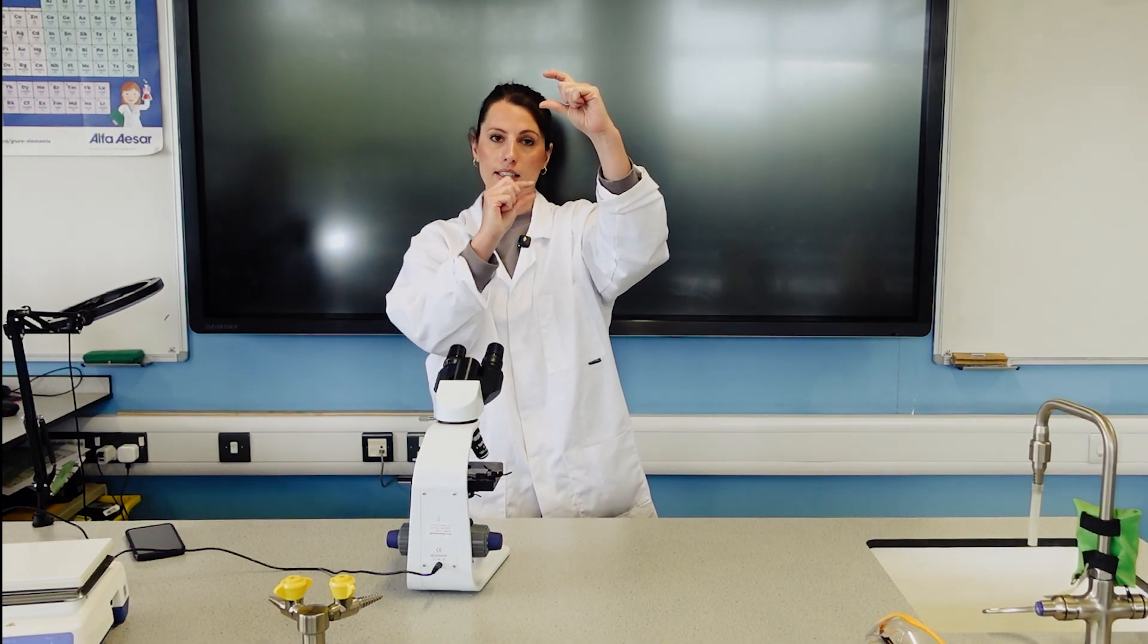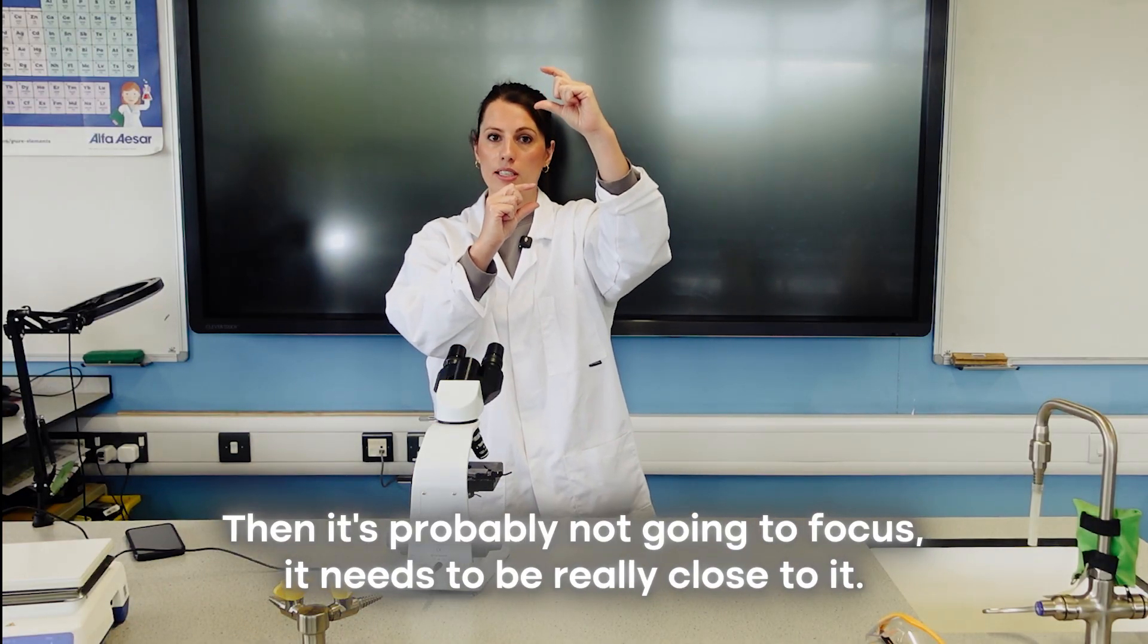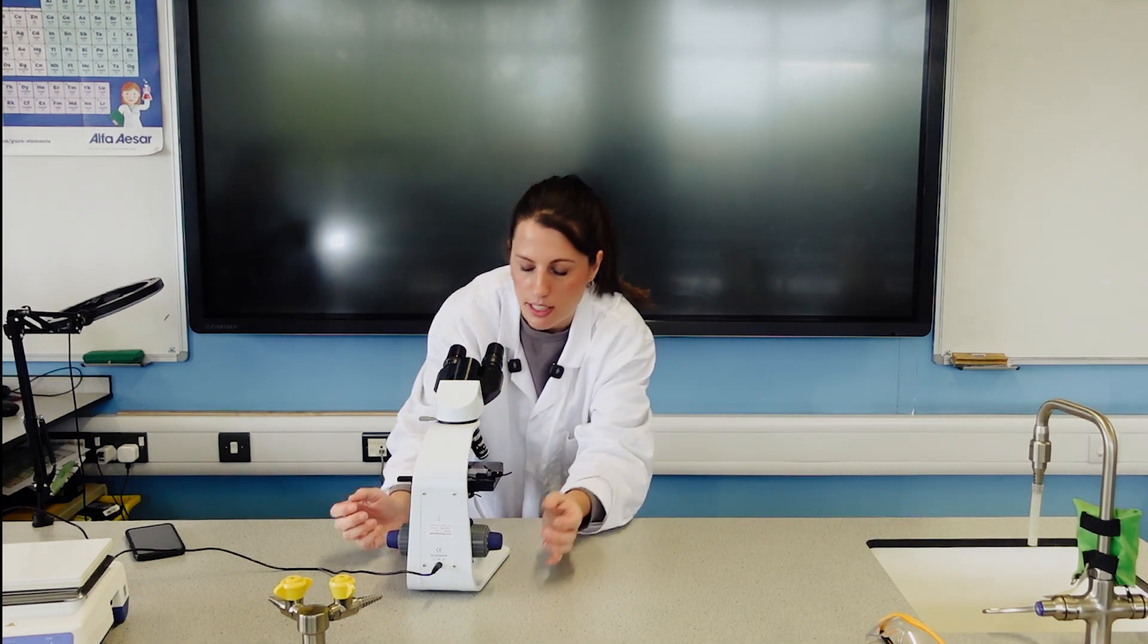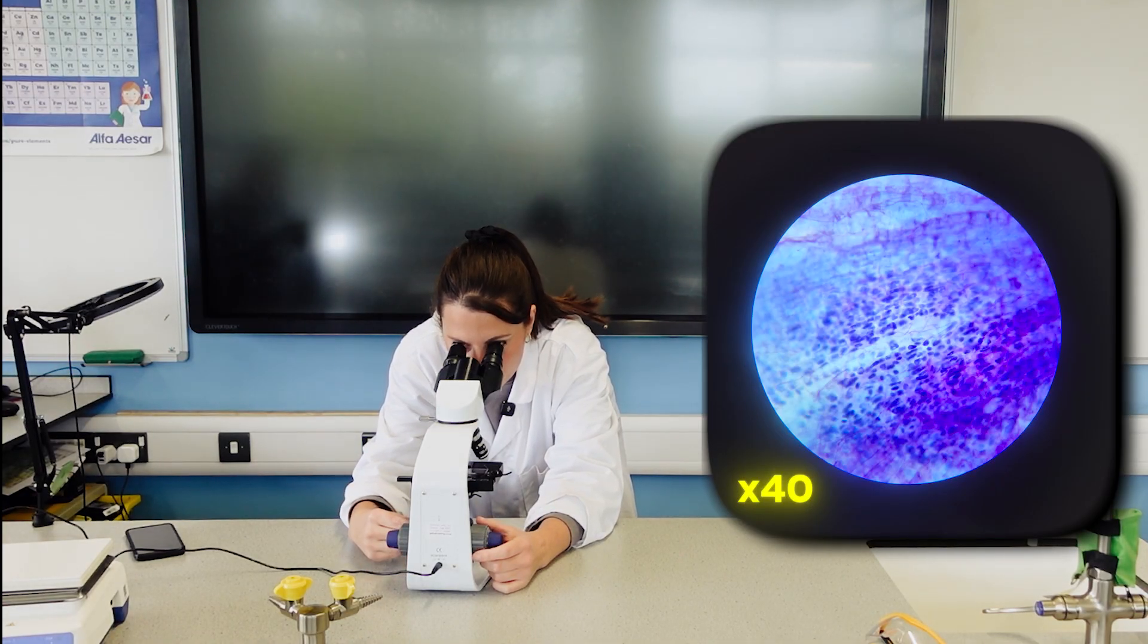If there's a big gap between the lens and the slide, then it's probably not going to focus. It needs to be really close to it. As I said, check that they don't then move it all the way down and it crushes and smashes the slide.